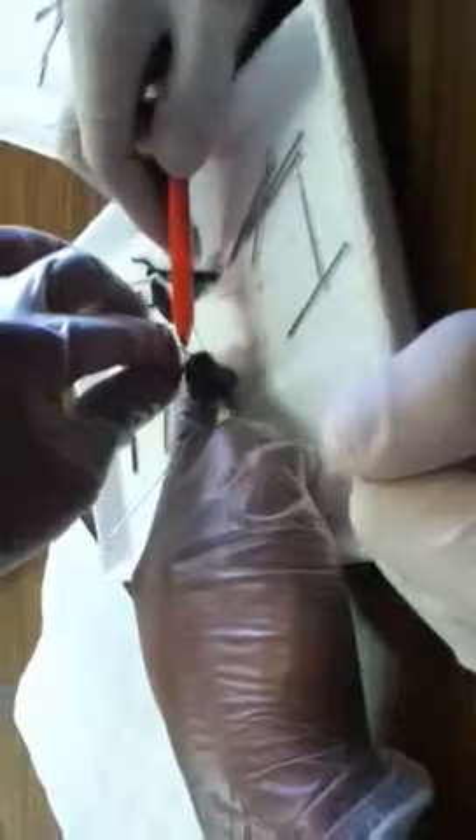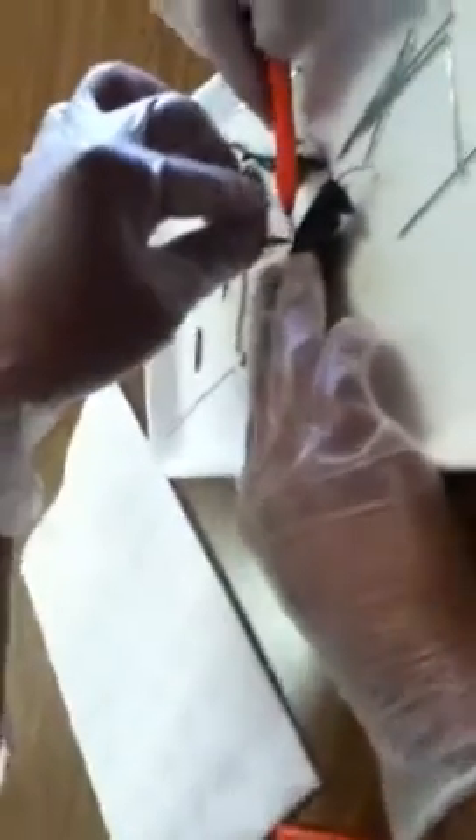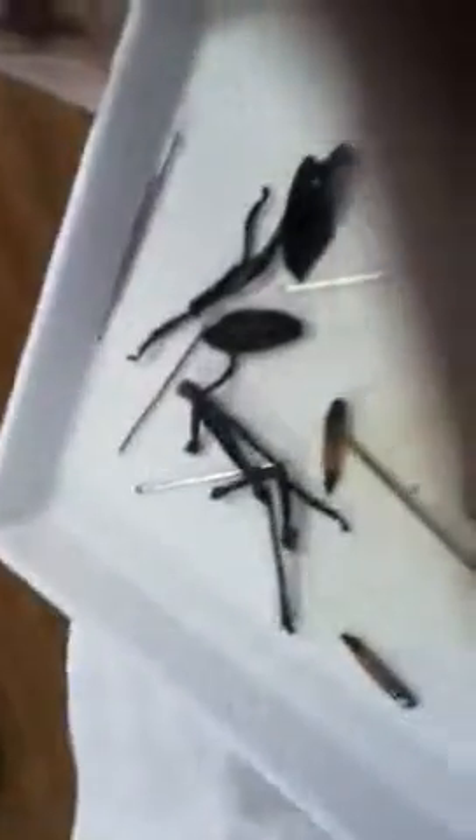Do I think you're squishing it? I know. It's all flat now. So cut down its back. Fucking stab it. Put it back down — dude, it's all juicy. Okay, let me fix him. Let me make him puff. There they go. Okay, show it and then turn it off.